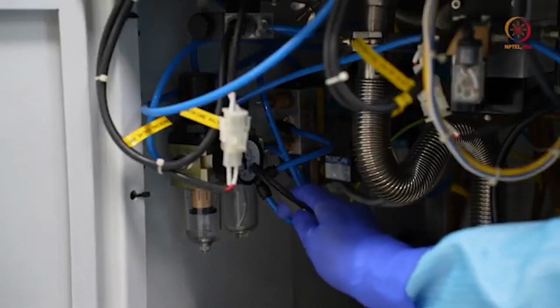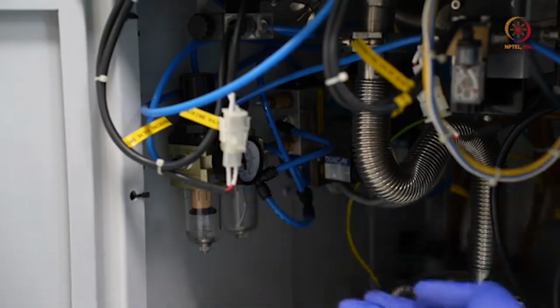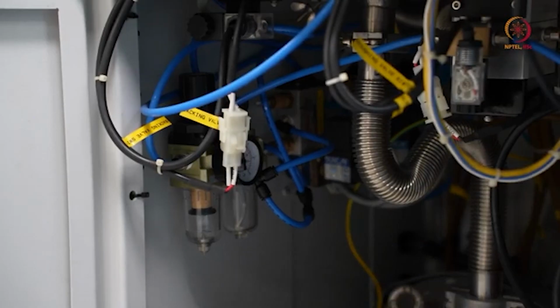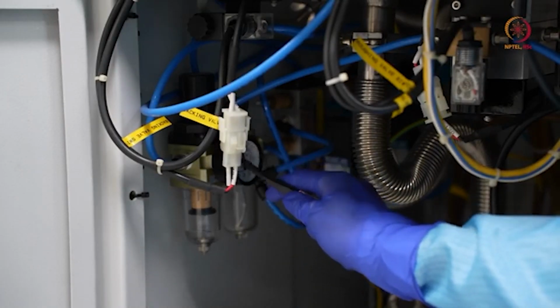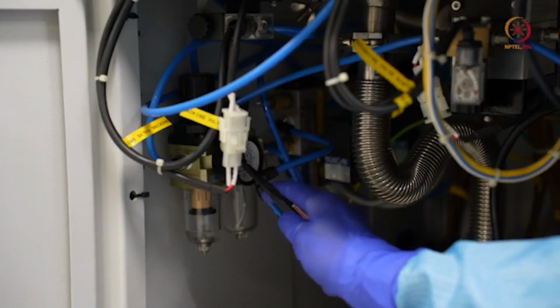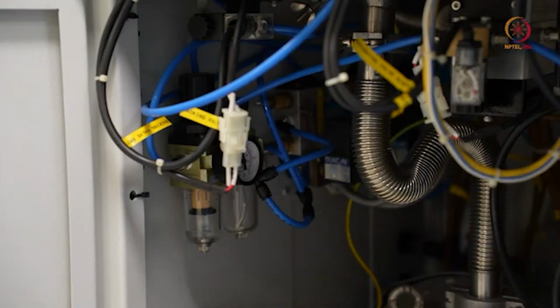So here you can see, as you remember, from outside we showed one air supply port, or one air supply line, and that channel came through this. From here we can see how much pressure is there and how much pressure will act on the pneumatic valves here, because that is one of the main things that will decide whether the valves will open or close or operate or not. So before starting the tool, if you are not sure, you can just check here whether you have the pressure.